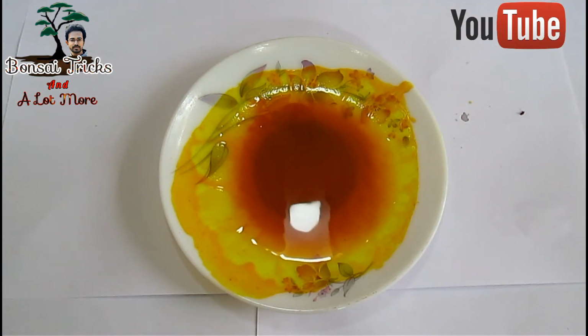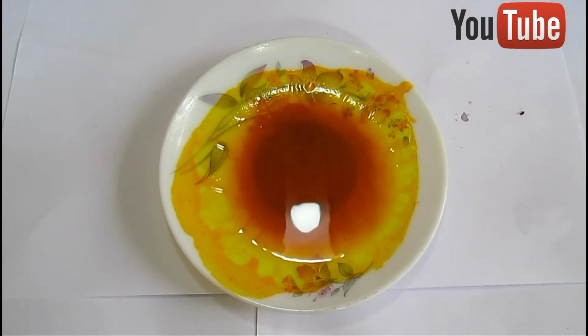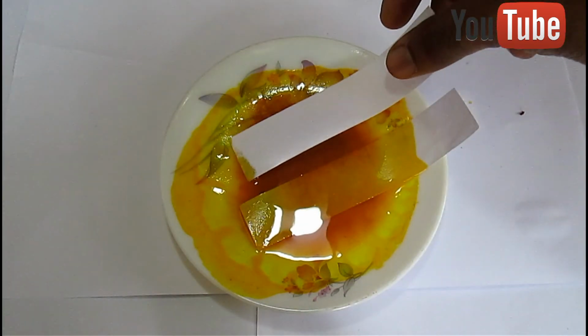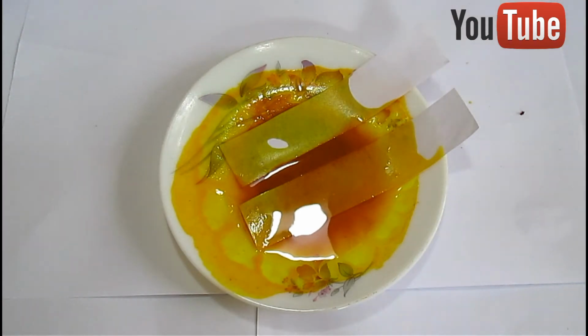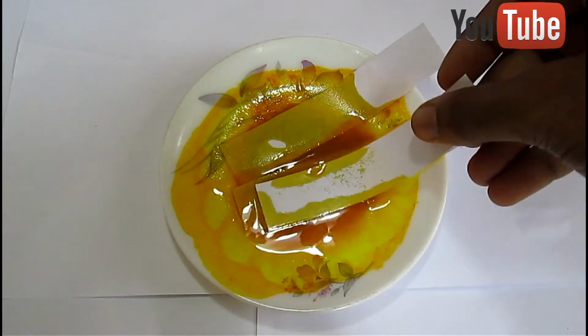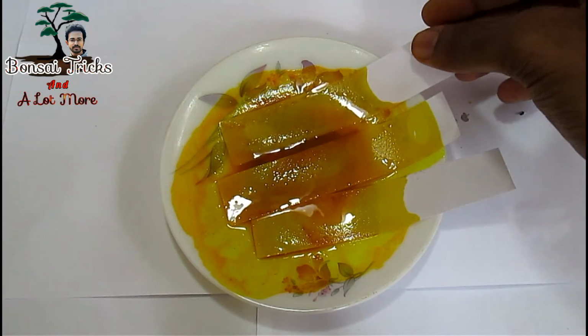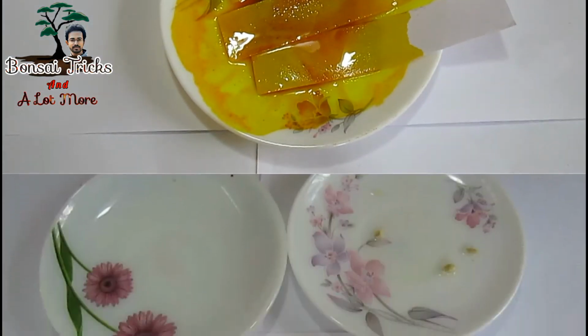Soak the filter paper or ordinary paper into your turmeric solution as you have done in the rose solution, which I have shown in the video previously. And only one exception has to be made. Do not soak the paper strip for a long period of time, just soak it into the solution and remove it.